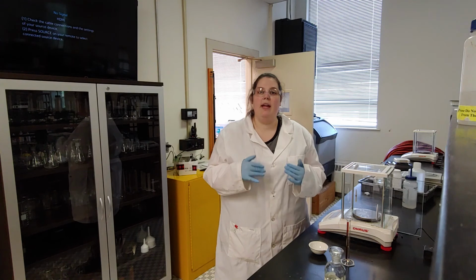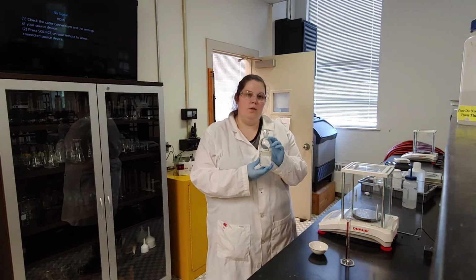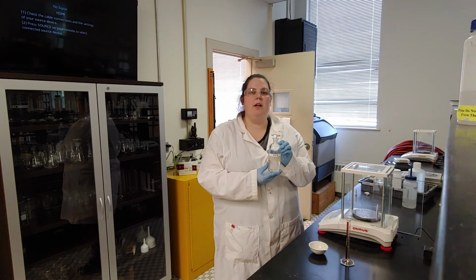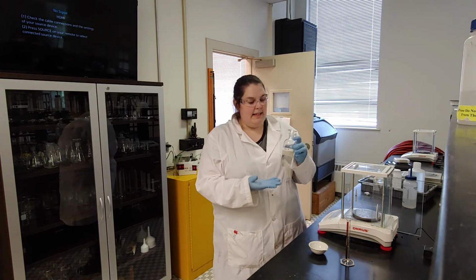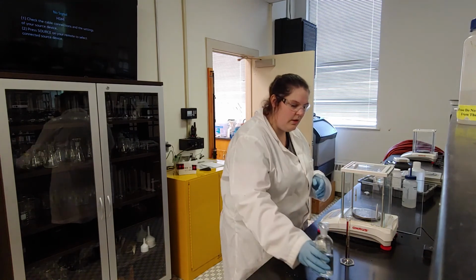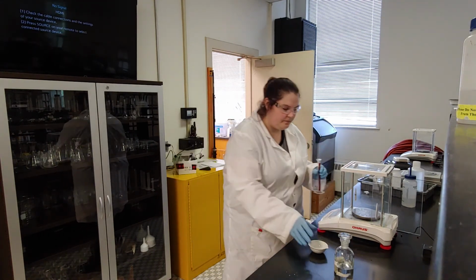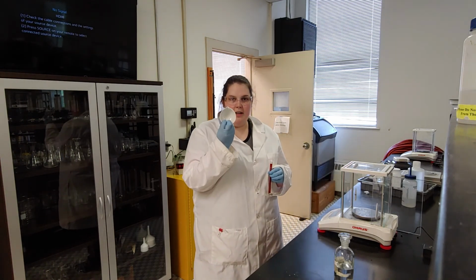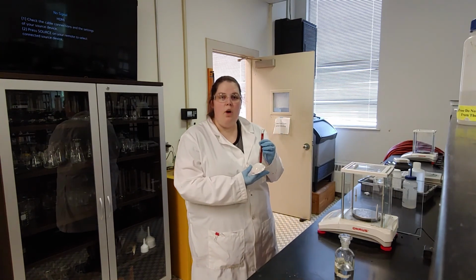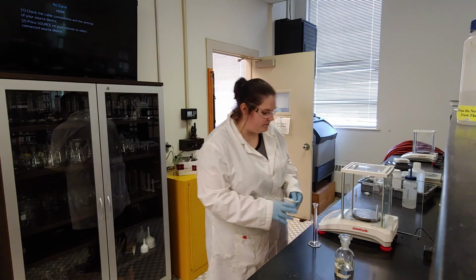The reason why we care is because the point of part 1 is to look at a KCl solution and determine what its concentration is. Today we will be looking at KCl solution B. It doesn't say what molarity it is because we are going to figure it out. I'm going to start with 5 milliliters of KCl and put it in an evaporating dish. We're going to heat up the evaporating dish and boil off all the water so that only the KCl salt remains.